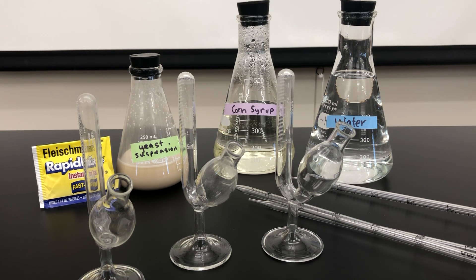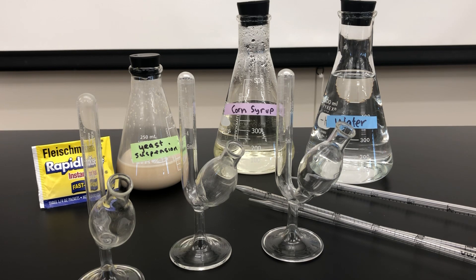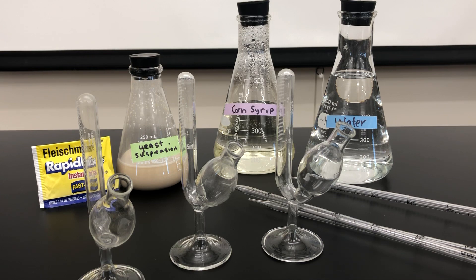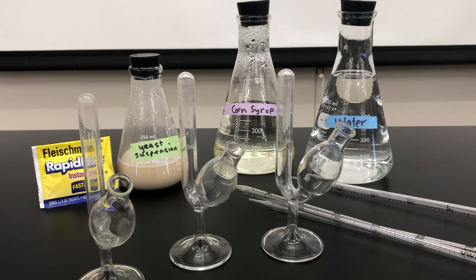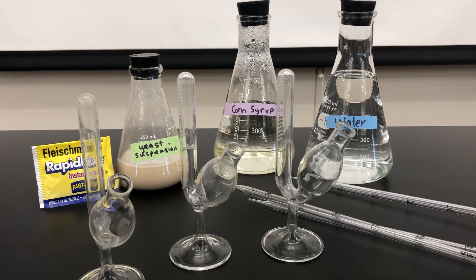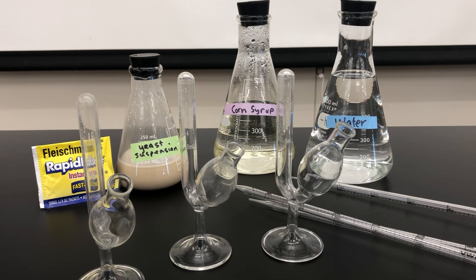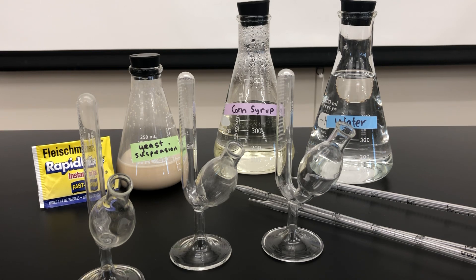We'll go ahead and fill these three fermentation tubes with the amounts listed on table 5.1. We'll note the amount of carbon dioxide in the graduated stem at time zero, and then we'll check them and record any carbon dioxide in five minute intervals.